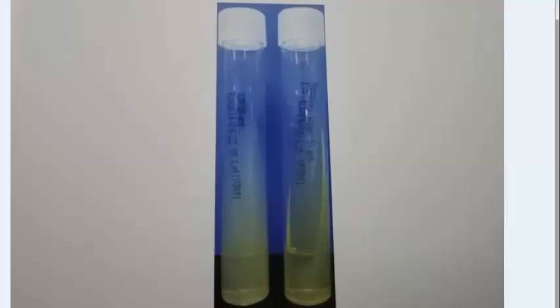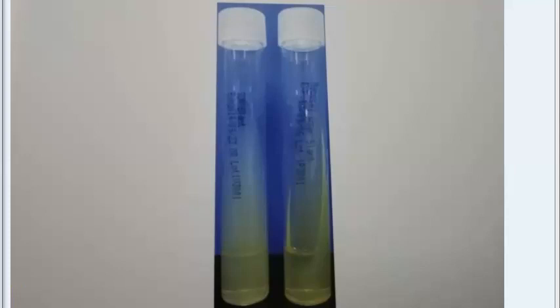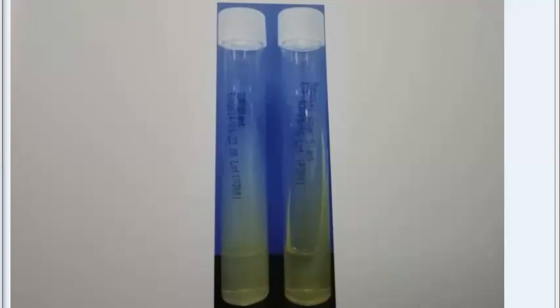Sabouraud's dextrose agar (SDA) is used for culturing fungi. It has high sugar content, low pH of 5.4, and can contain antibiotics like cycloheximide and chloramphenicol to inhibit bacteria. It is used for isolation of dermatophytes, Candida, and Cryptococcus neoformans. Dermatophytes give white colonies, Aspergillus niger gives black colonies, and Cryptococcus and Candida give creamy white colonies.